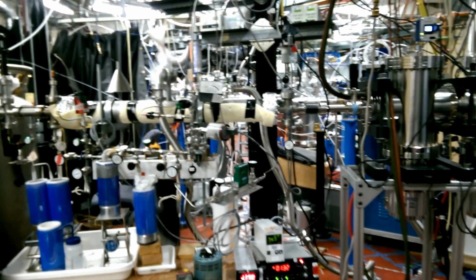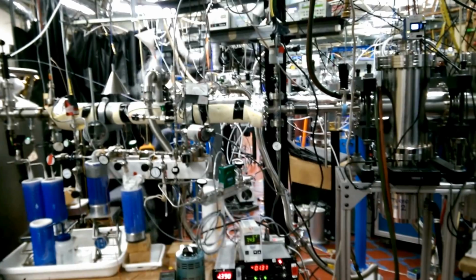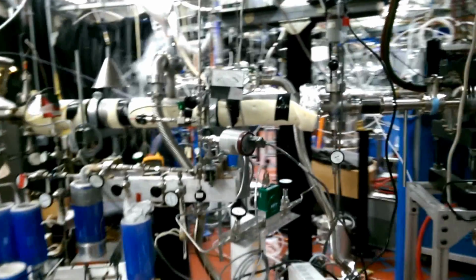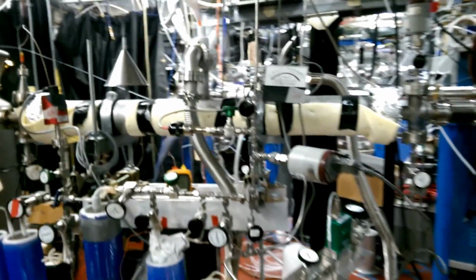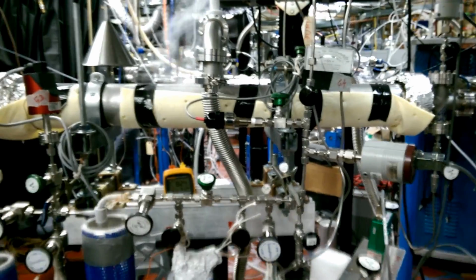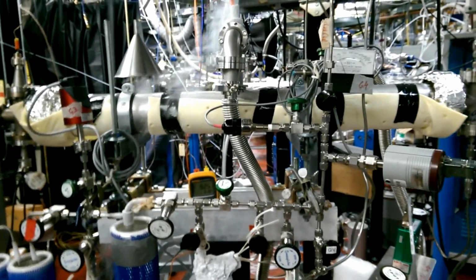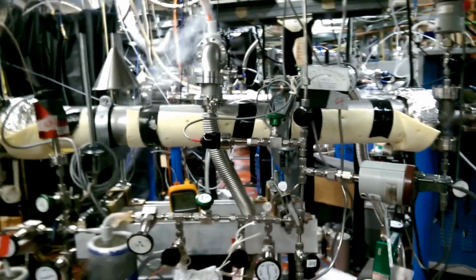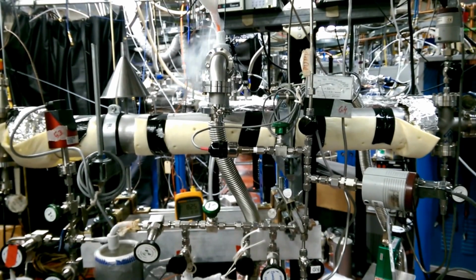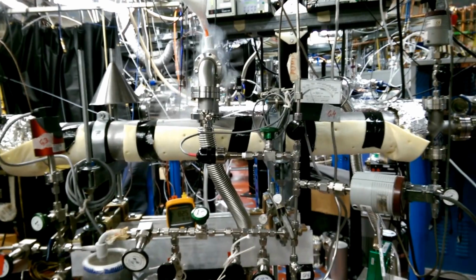I'm going to introduce you to a very nice experiment going on at Chemical Dynamics Beamline 9.0.2 at the ALS synchrotron, which is at LBNL Berkeley. In this experiment, we are trying to create the conditions of the early solar system, where we are dissociating CO in the presence of hydrogen. That is known to be one of the processes in the early solar nebula, and it changed the isotopic composition of some of the abundant gas species like oxygen, carbon, and so on.